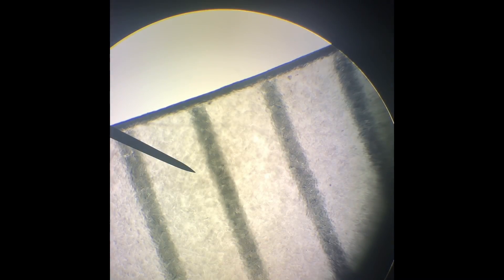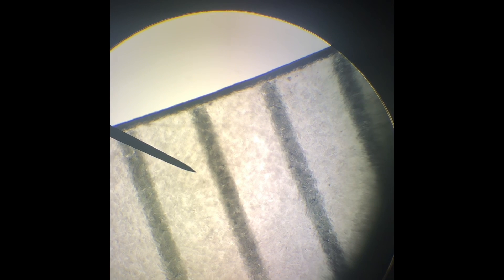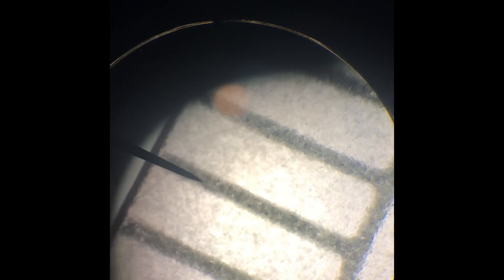Here's the video of my field of view that I've got set up — that's the ruler underneath. The iPhone camera actually magnifies it a little bit more even than the eye. Each of those little lines — right now that black little needle tip is pointing to one of the lines — each of those little lines is one millimeter.